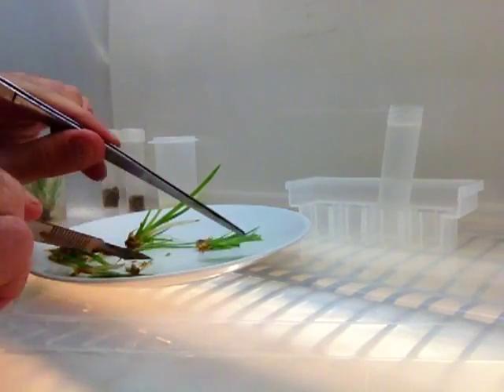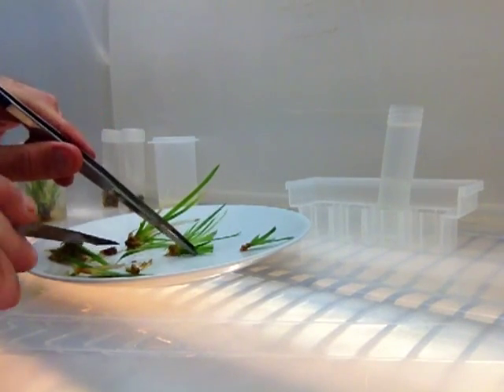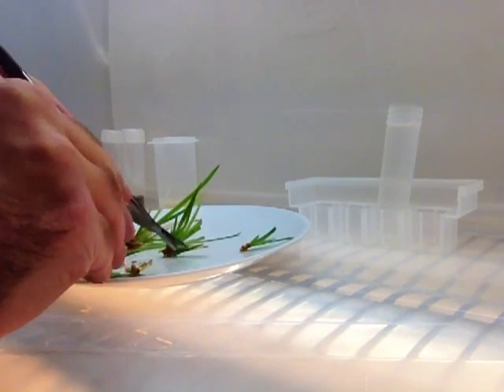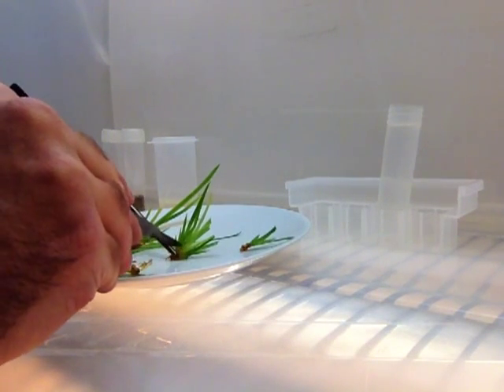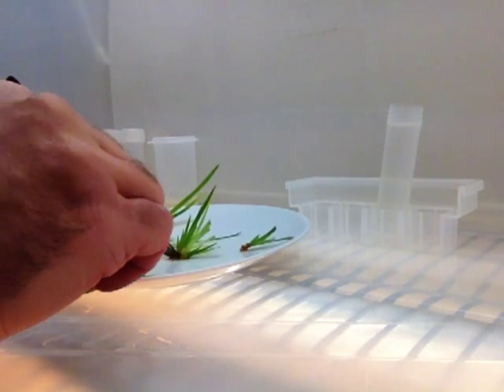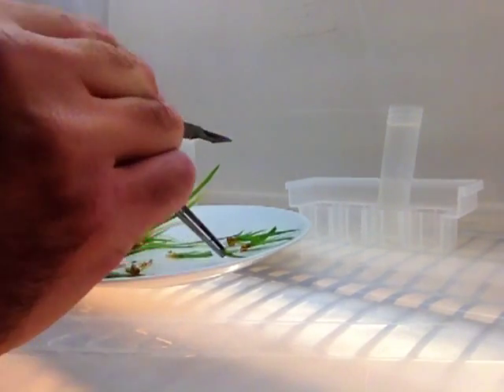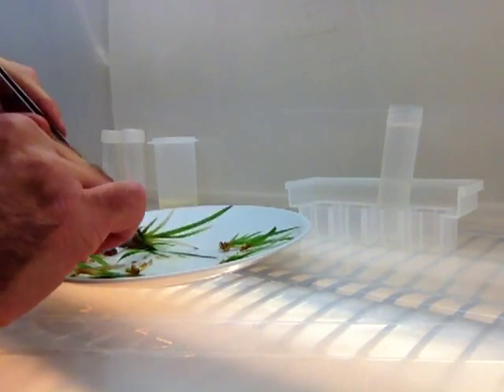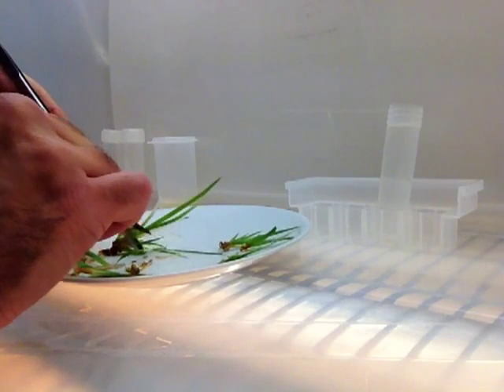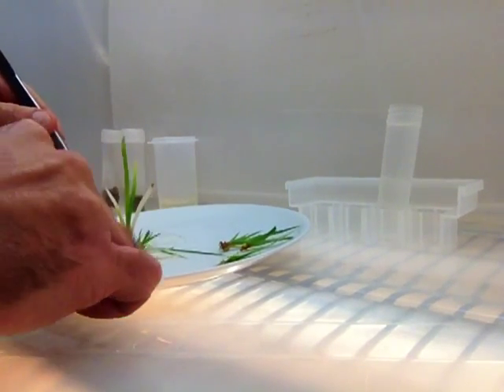There's my first plant. I set it to the right side of the plate with the top pointed out because I'm right-handed. Then I'm going to go ahead and just split these guys — one, two, and three. I can either go ahead and plant those in containers now or finish this up. This is pretty easy, so I'm just going to go ahead and finish it.